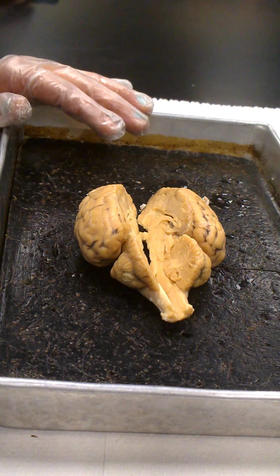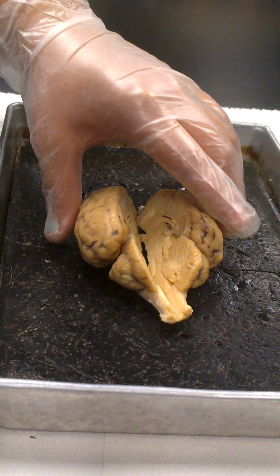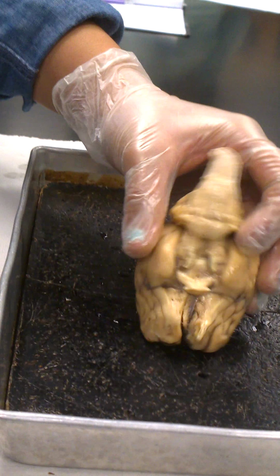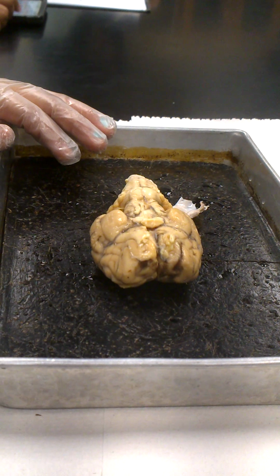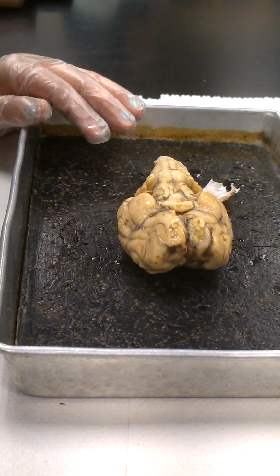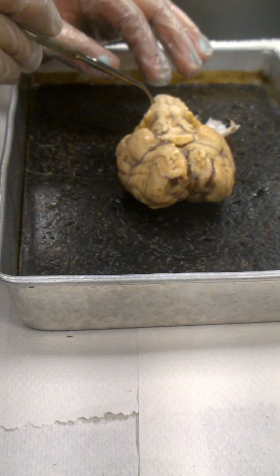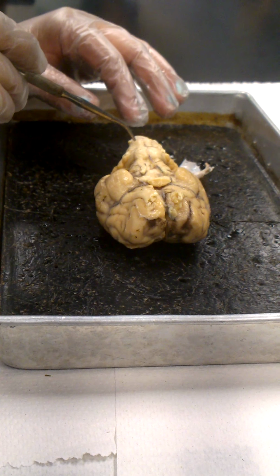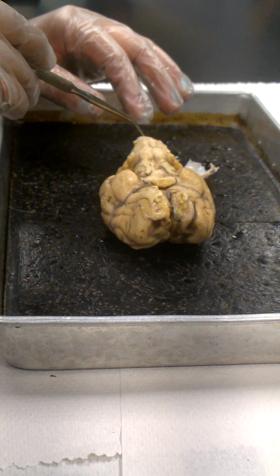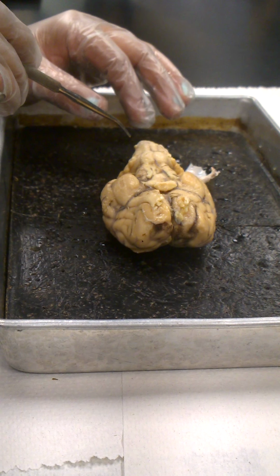In addition, from the outside, we can see the pons and the medulla. I'm going to flip the brain over here so that we can see those structures on the lower portion. Looking at an inferior view of the sheep's brain right now. The pons actually at this moment is partially covered by this flap of tissue right here, but these enlargements right here would be the region of the pons. And just behind it, this other enlargement area right here until it turns into the spinal cord and continues on out. This region would be the medulla oblongata.